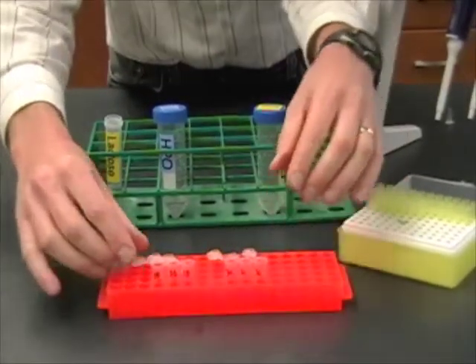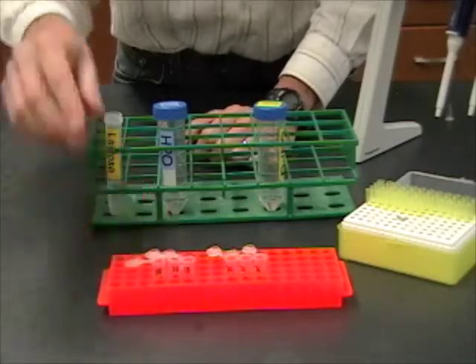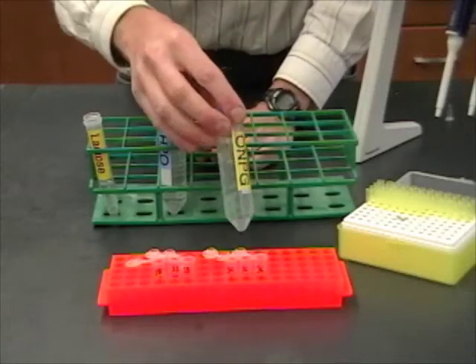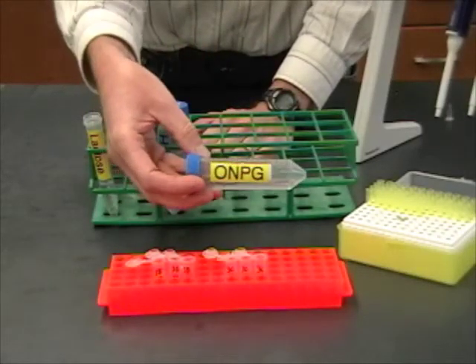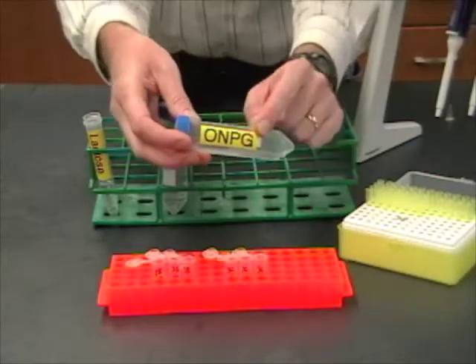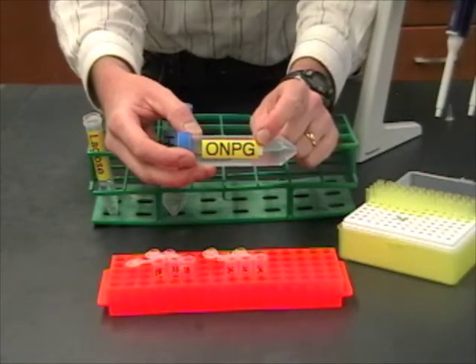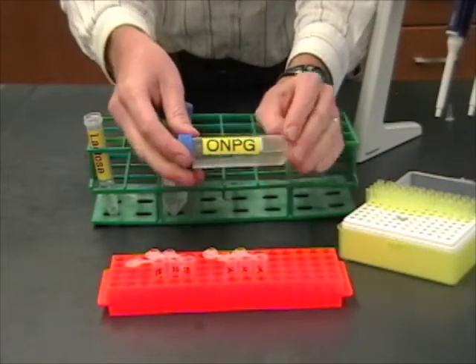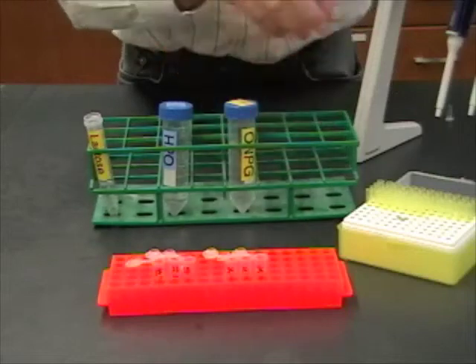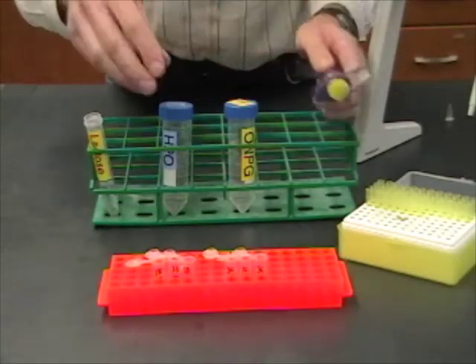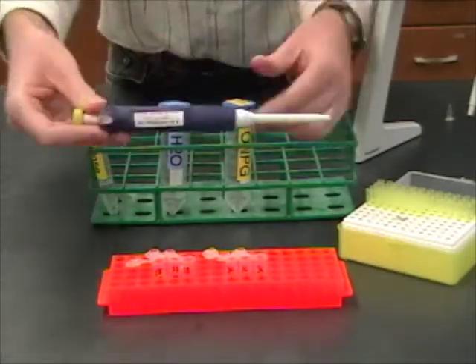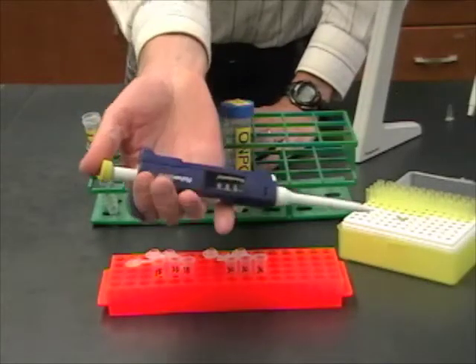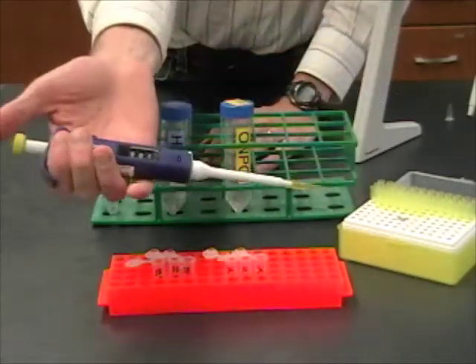Okay. At the moment, these tubes don't have anything in them, but all the tubes that are labeled B here, they need to get water. This is going to be the blank. And, the tubes that have C in them, those are going to get this stuff called ONPG. Of course, that's an abbreviation for a long chemical name, but this is the substrate for the beta galactosidase enzyme. So, if beta galactosidase is being expressed by the bacteria, then it's going to react with this, and that's going to produce a color change that we can watch in the spectrophotometer. Now, each one of my tubes is going to need 200 microliters of either the water or the ONPG. So, I've got my pipetter. I've set it for 200 microliters here.